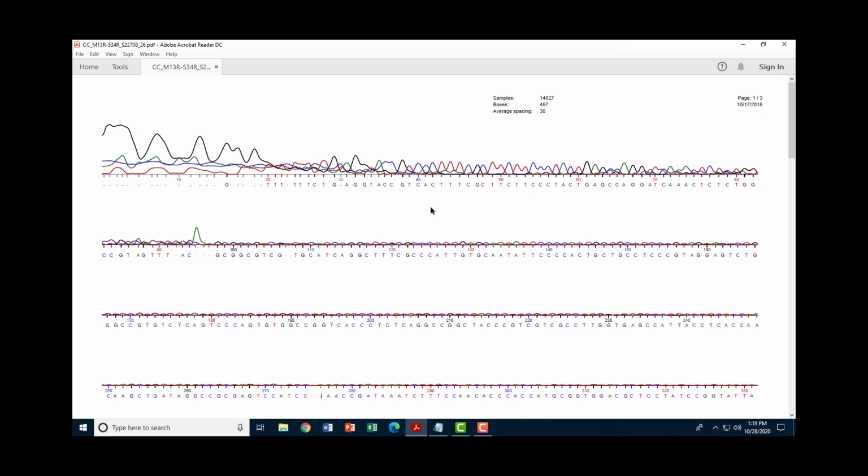So basically, that's what you would do, is you'd go through and clean up the single nucleotide missing results to see if you can figure it out. After you do that, you could try running your blast search again and see if you get a better result.